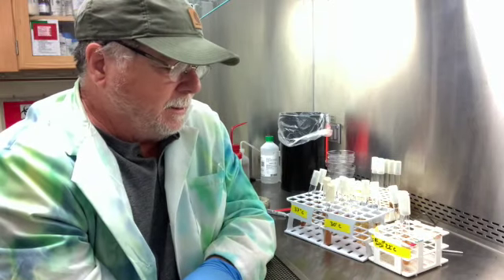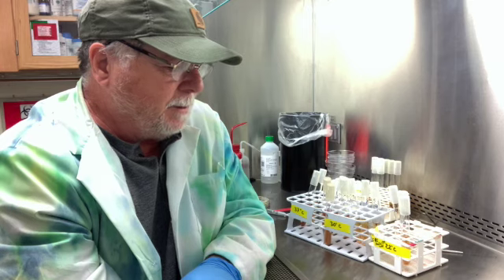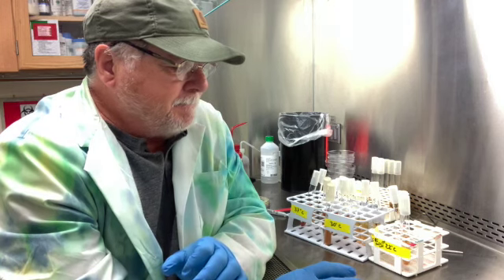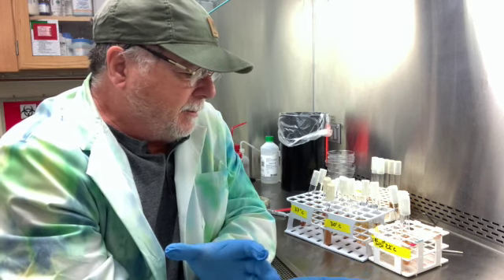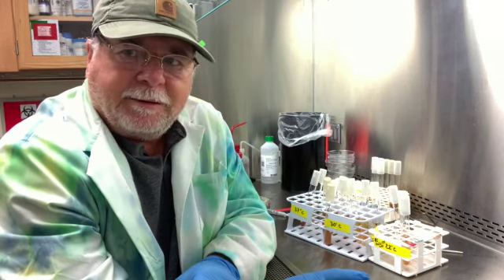Okay, all right, that's it. You can contemplate the results. Some of this you still have to treat with a little bit of skepticism, because whether it is motile or non-motile is also going to depend on the size of the bacteria.